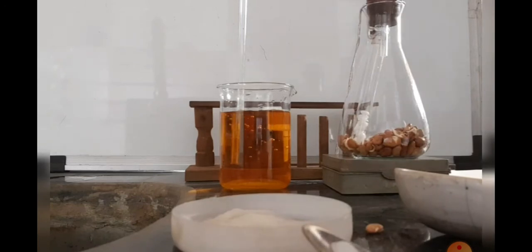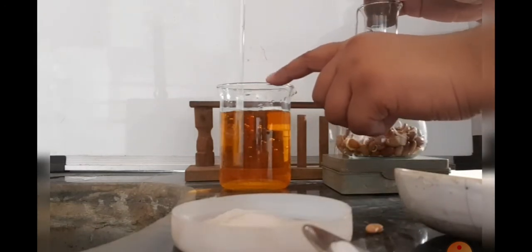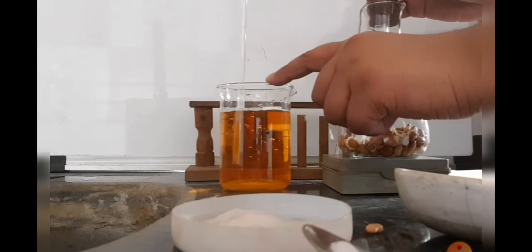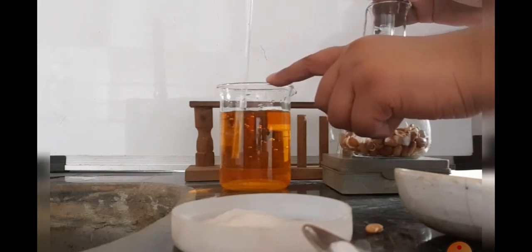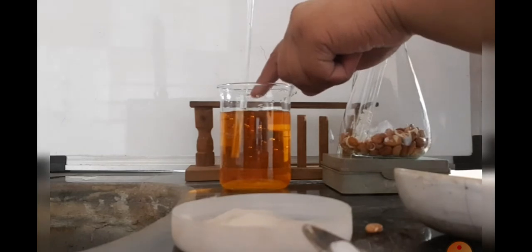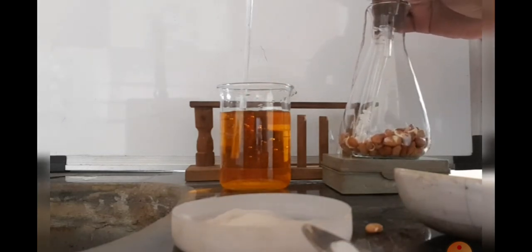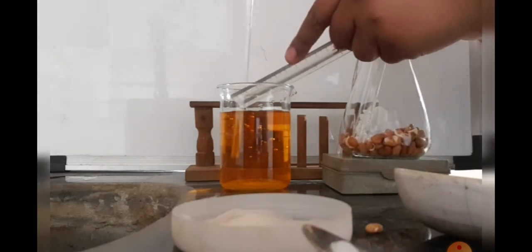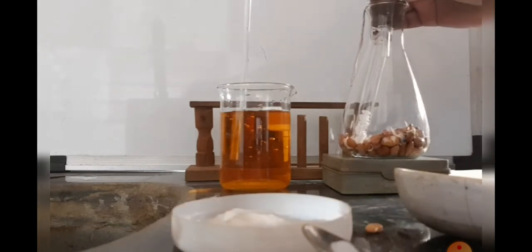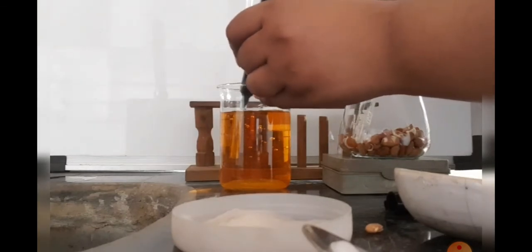Now initially, after we inserted the large end of the bent tube into the beaker, we have to mark the initial level of water. Here with the help of a marker, you can see the water level at that point. We now mark that initial water level in the bent tube.